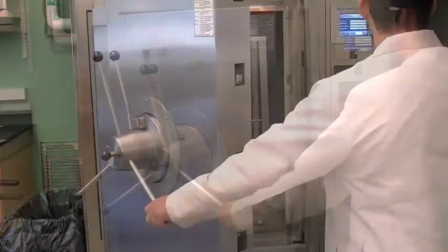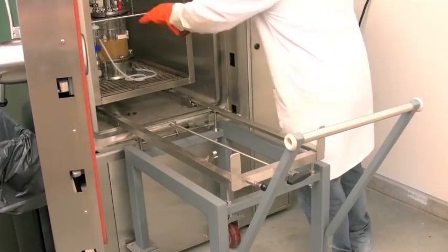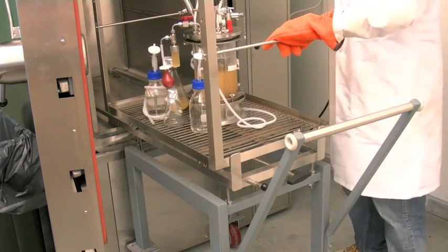After autoclaving, carefully remove vessel and solutions from autoclave using heat resistance glove and set up in lab.